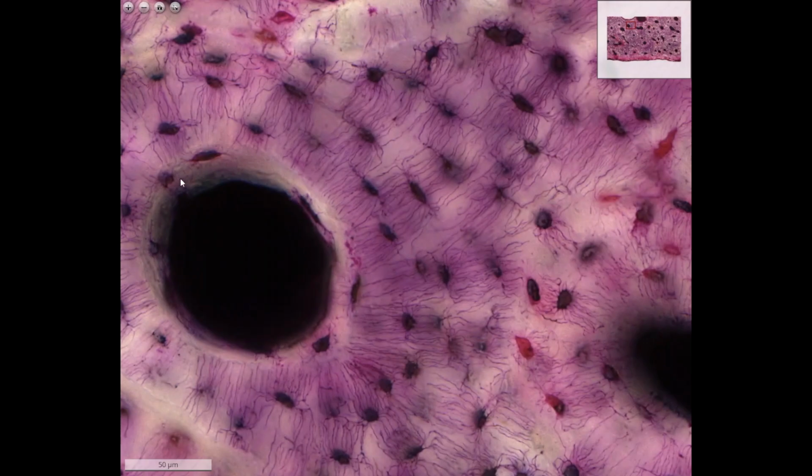So what happens is that in the Haversian canal, the blood vessels and the nerves are running, surrounded with a little connective tissue. And from the blood vessels, the nutrients are passed on by the processes of these osteocytes through the gap junctions to the peripheral lamellae. This diffusion has a limit, so that also makes a limit for the diameter of the osteons.